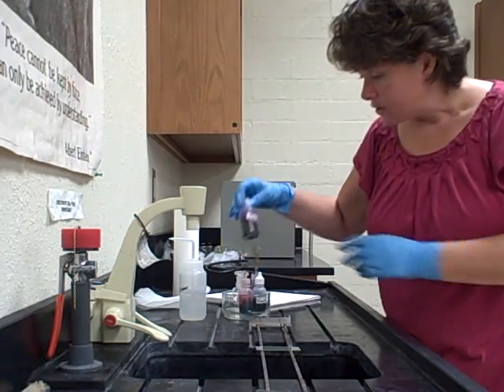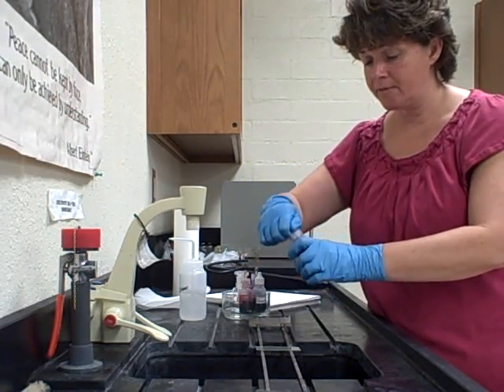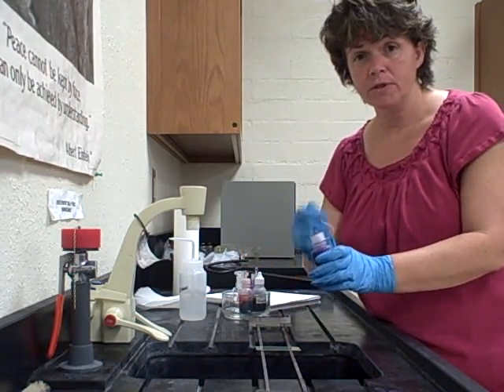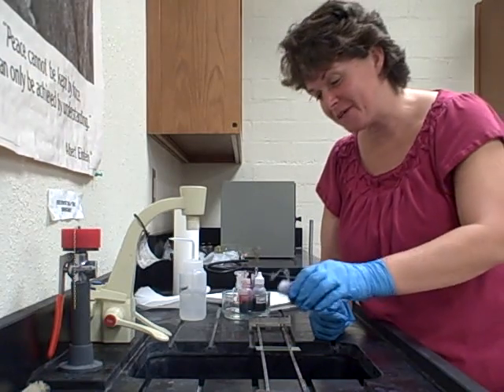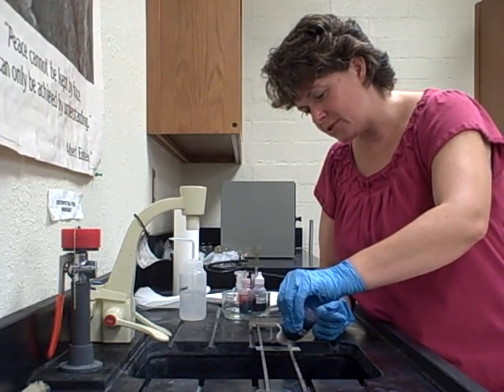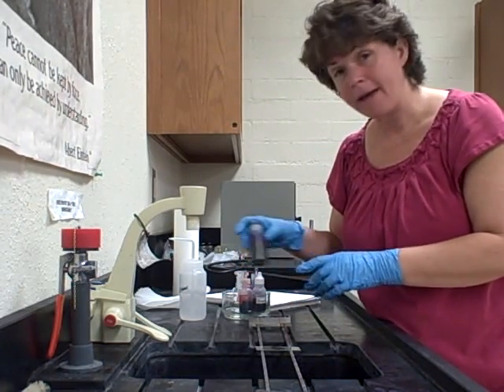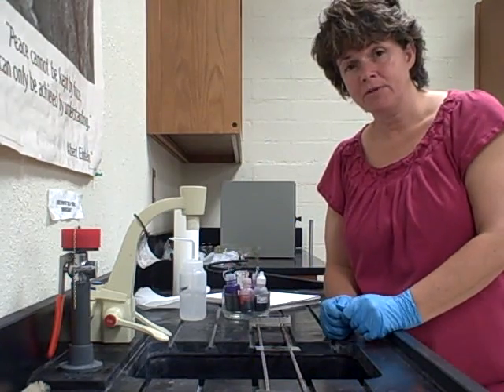The first thing it says to do is cover the smear with crystal violet. These are stains and they will stain your clothes and your hands, so be careful — use gloves, or you can use clothespins. Flood the slide and let it sit for 30 seconds; if it goes 45 seconds that's okay.